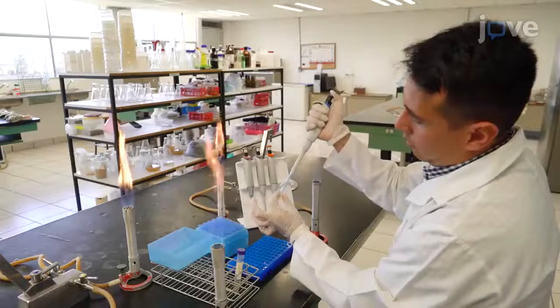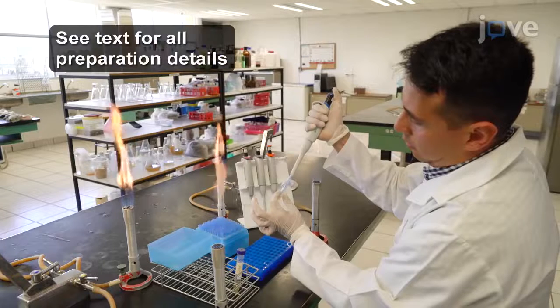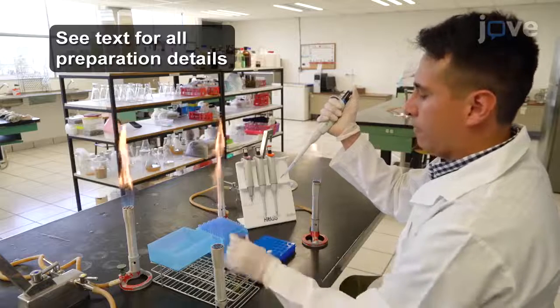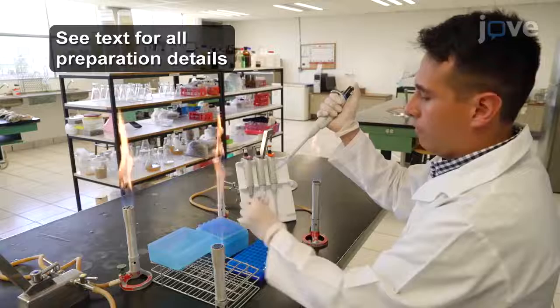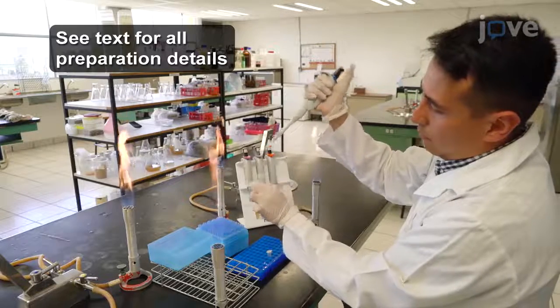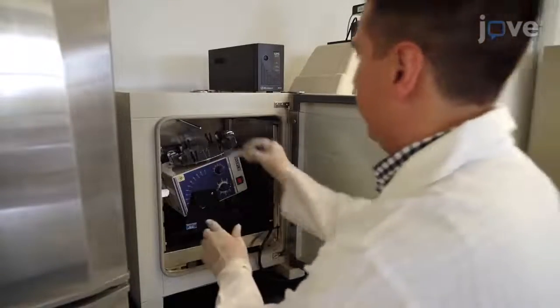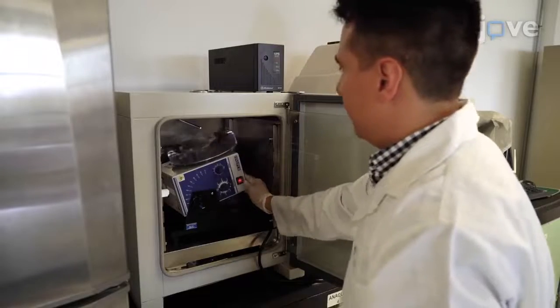Begin by inoculating a 15 milliliter conical tube containing 3 milliliters of cool, sterile 2% yeast extract peptone dextrose, or YPD, broth with 250 microliters of S. cerevisiae cells, preserved in glycerol at -20 degrees Celsius. Incubate the yeast overnight in an orbital shaker at 30 degrees Celsius and 200 RPM.